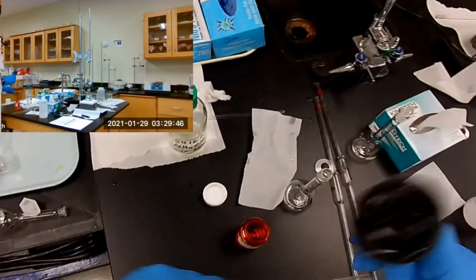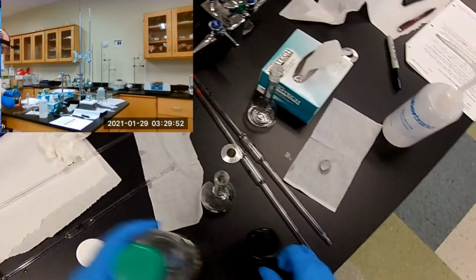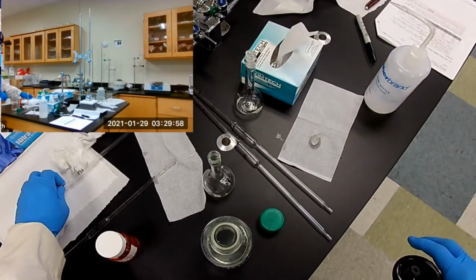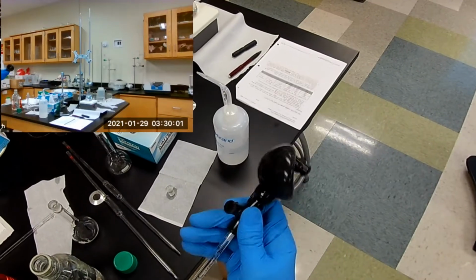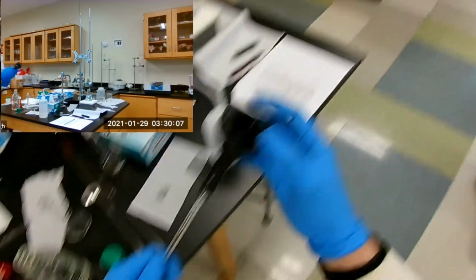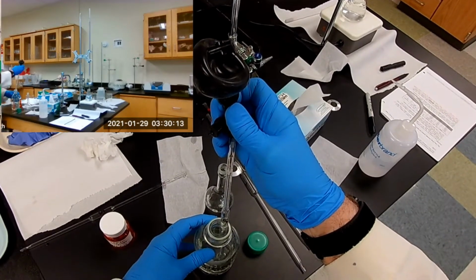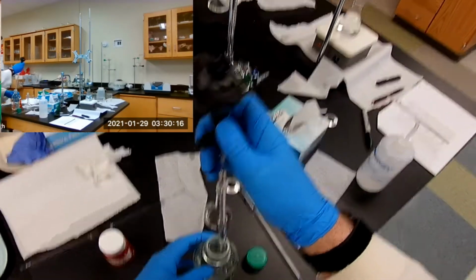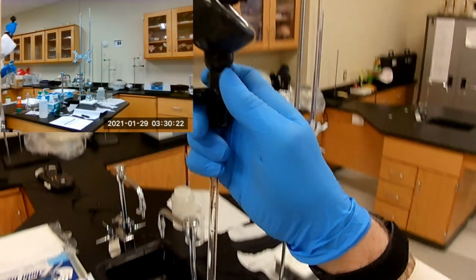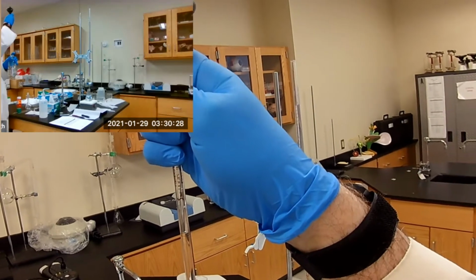All right. So now we need 5 milliliters of ammonia. Something too far. Back it up. There we go. Right on the mark.